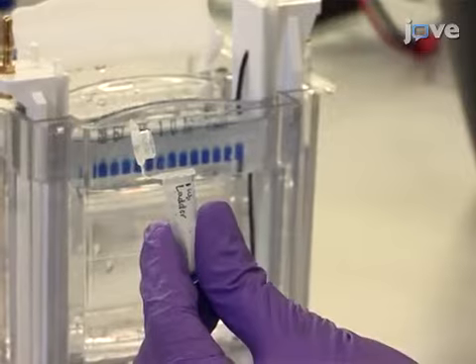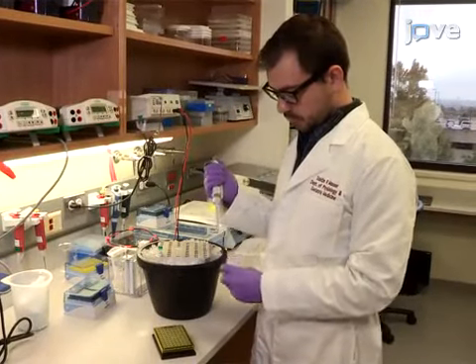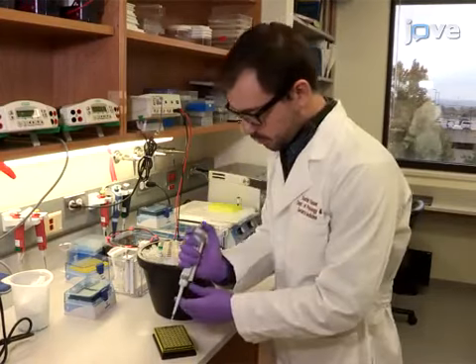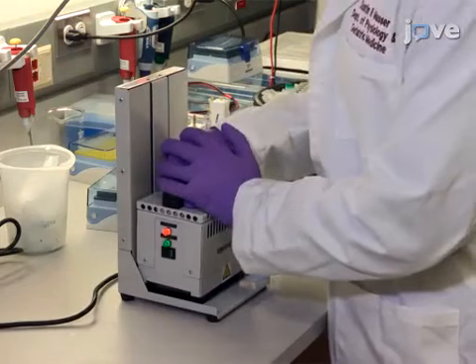After identifying the target and designing the primer, assemble the reaction for the target amplification optimization of a single amplicon, and then seal the PCR plate with heat-sealed film.